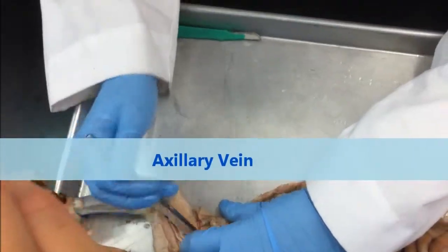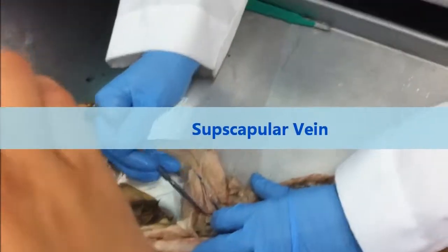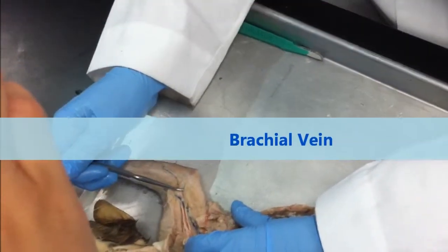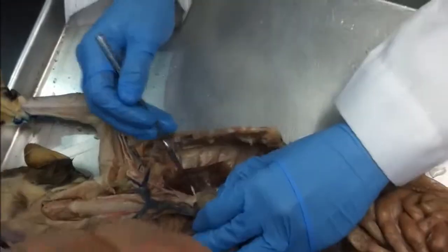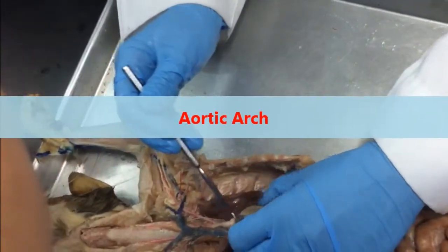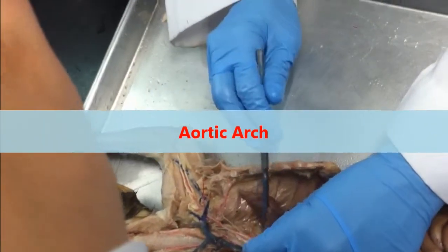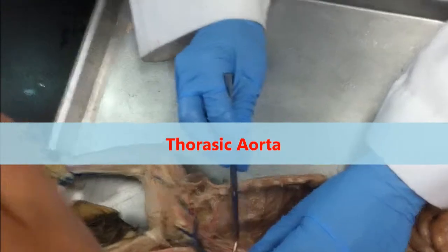Axillary splits deep and out. The deep is the subscapular. Out is my brachial vein. Okay? From the heart, my arteries. What's this top thing right here? Aortic arch. Aortic arch is going to go down to thoracic aorta and splits up.